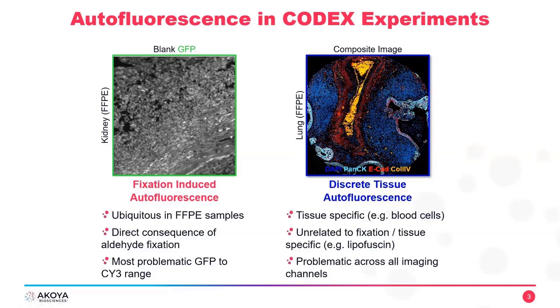This is not collagen. So these are specific elements or discrete structures within your tissue that are autofluorescent very strongly. We don't want to see erythrocytes in this experiment, yet they are the most prominent feature on the image that I'm showing you here. So without saying much more, it's pretty clear that autofluorescence is problematic, and it shows itself in many different ways, and it would be really good if we could deal with this, because the less autofluorescence we have, the better our experiment gets.